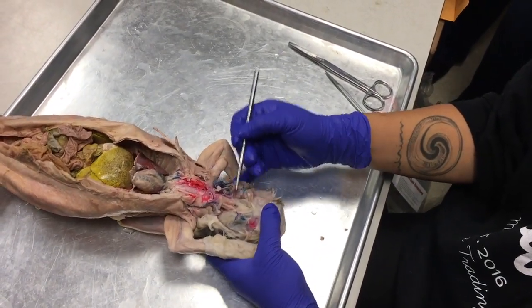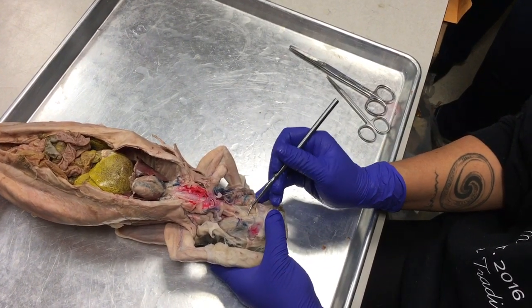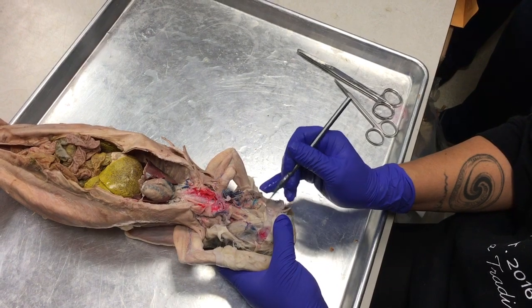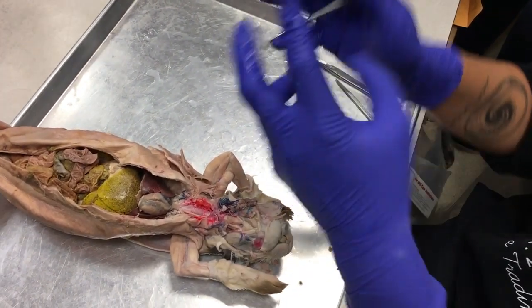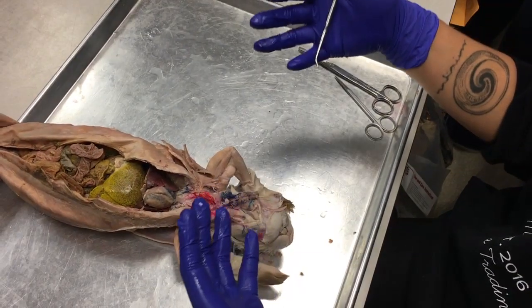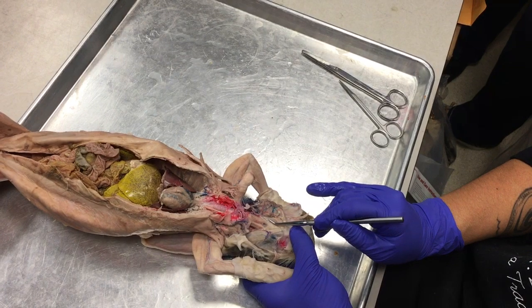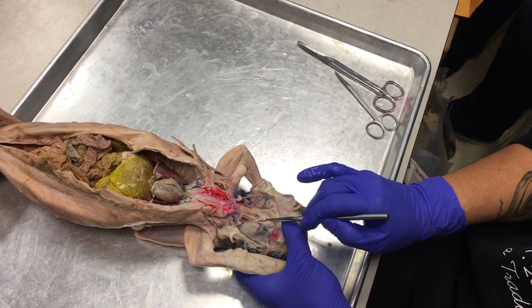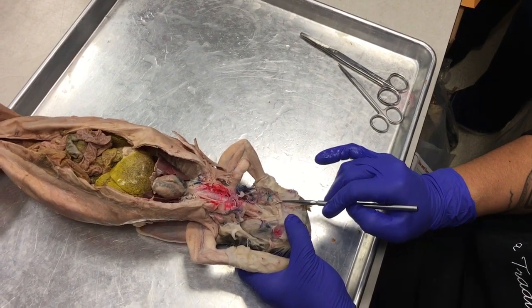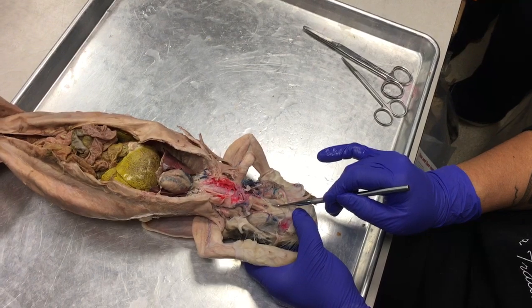There are two big strips of muscle that line the insides of those mandible bones, and those two strips are called the digastric muscles. There's two of them, and they're lining the mouth, which has to do with eating, so digastric. And then you'll see a sheet of muscle that runs between those two digastric muscles. This is the mylohyoid, okay?